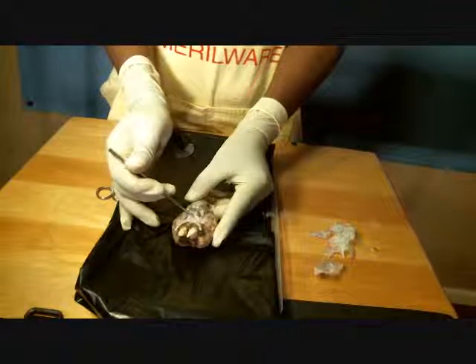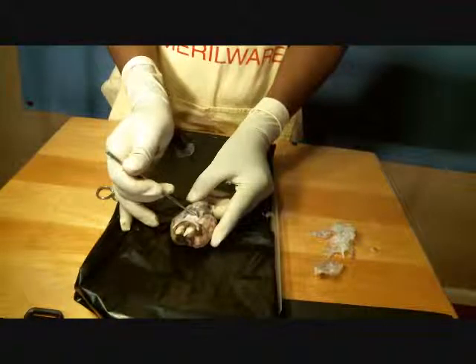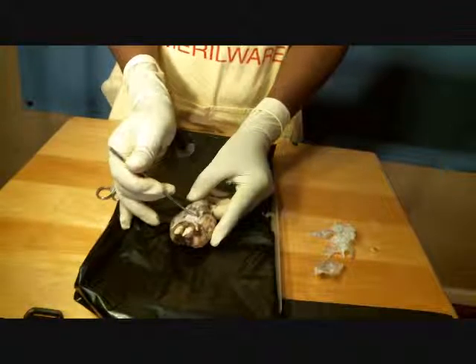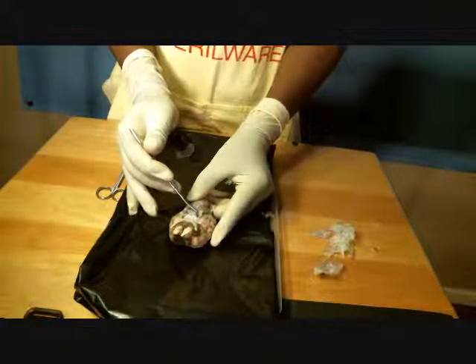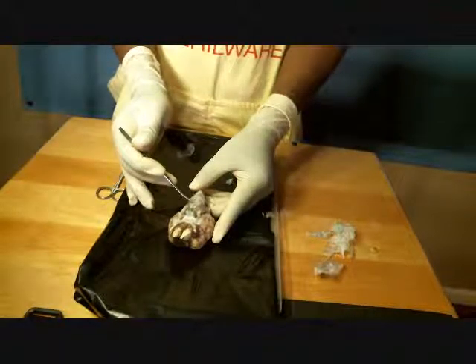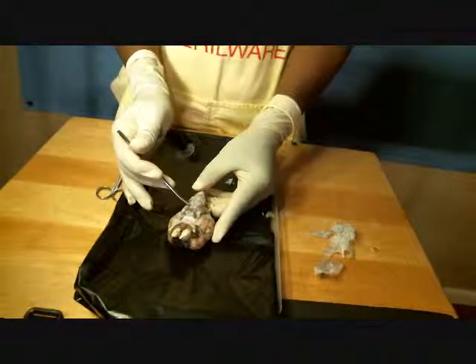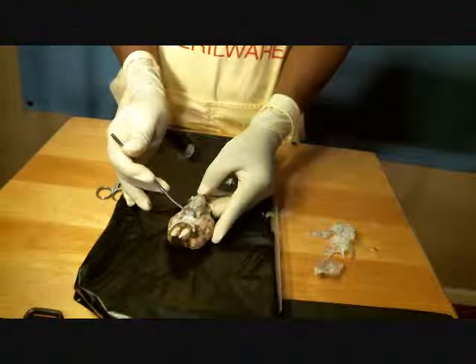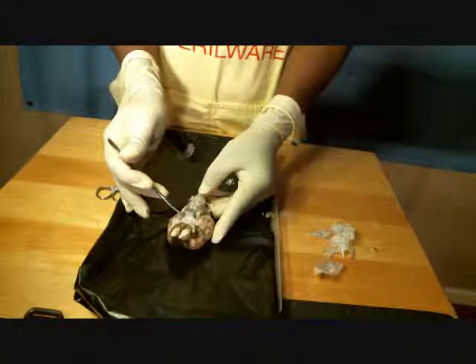At the bottom here of my X, you might say, is where I find located my trochlear nerve coming off of there. Right over here, I have my cerebral peduncle, my trigeminal nerve. As we come down, we have the medulla oblongata. As I go up a little higher here, we have the pons. Going further up, I have, I'm probably going to mispronounce this, my oculomotor nerve. Okay. And then we mentioned the optic tract.